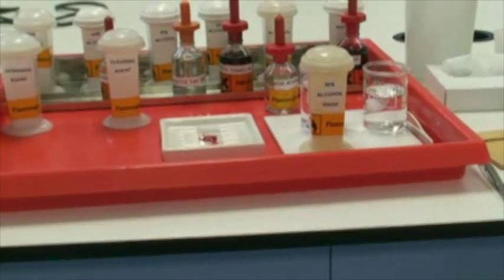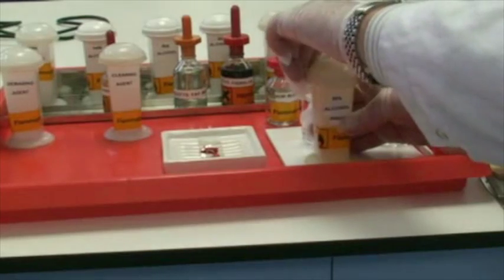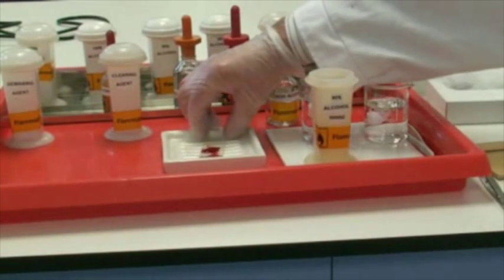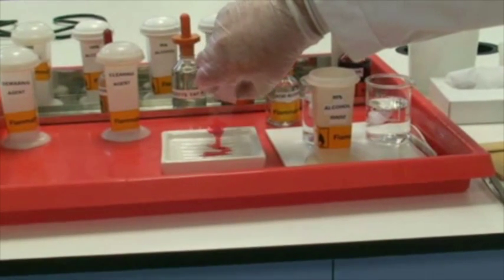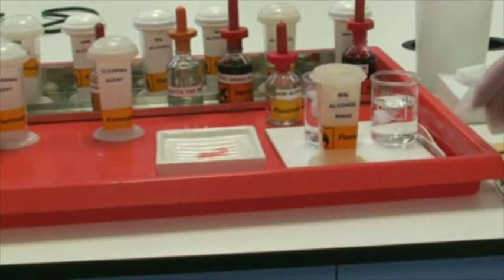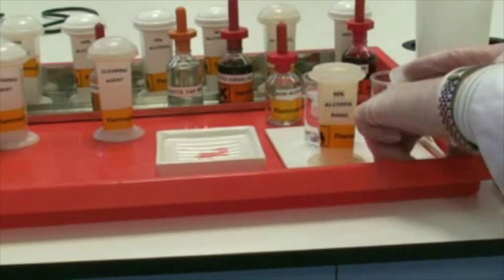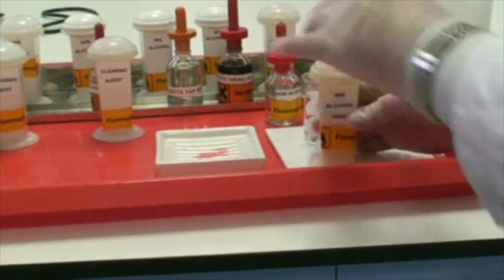I will drain off the slide and it will go into the rinse. We're now getting to that point. I'm going to remove the lid, drain down the slide, and then transfer across into the 95% alcohol rinse. I'm going to close the lid and leave it there briefly.